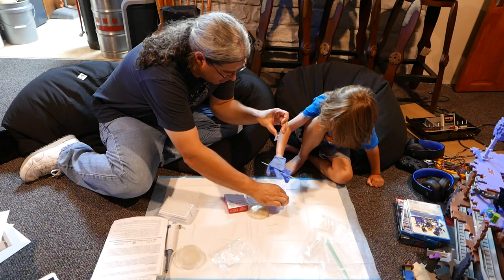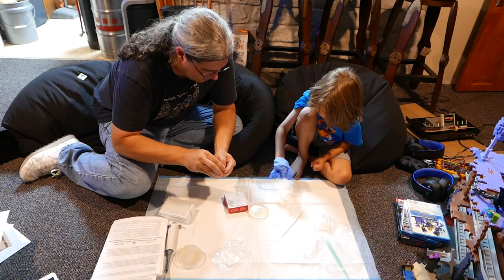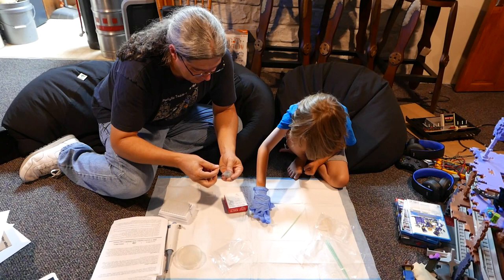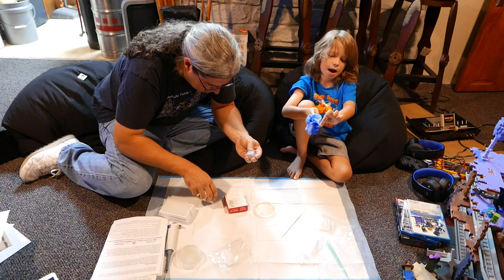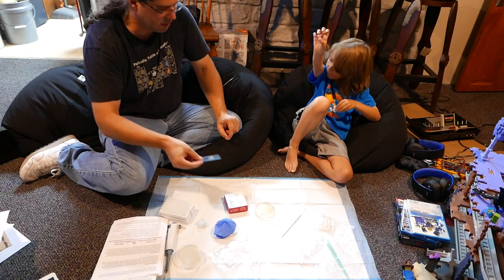Get one of these guys. Take your glove off — oh, actually, put the lid back on it first. I don't know how to do this with one hand. I think I do, so. There we go. Alright, so you should be good to go. My hand's not sweaty this time. You had a glove on, so let's walk around and see if we can do anything with this, okay?